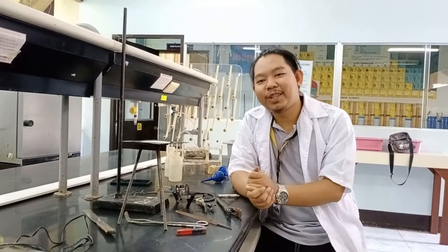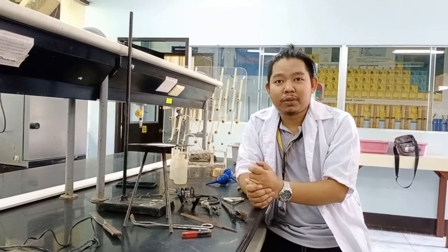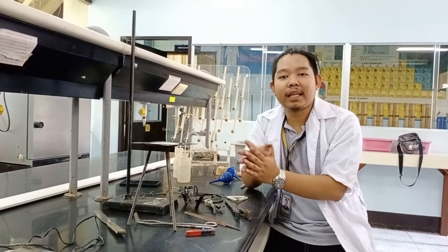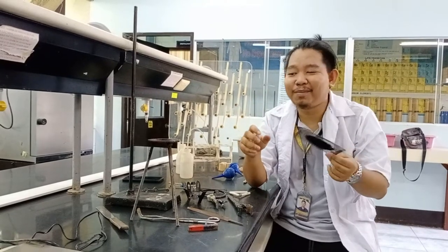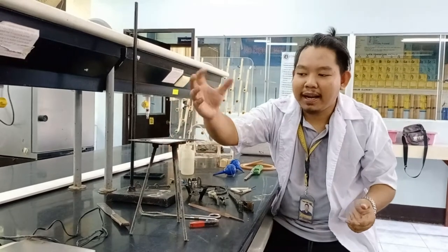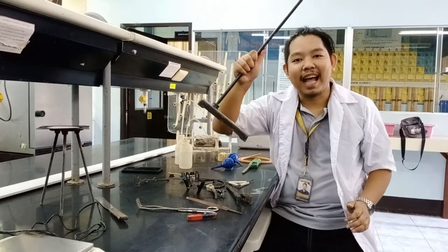Now let's proceed with some metal apparatuses. When dealing with flames — through a Bunsen burner or alcohol lamp — we use the help of these metals to be safer. We use wire gauze placed on a tripod for stability, with your alcohol lamp below. Sometimes if you want to use a Bunsen burner, the tripod alone will not suffice, so we use an iron stand.